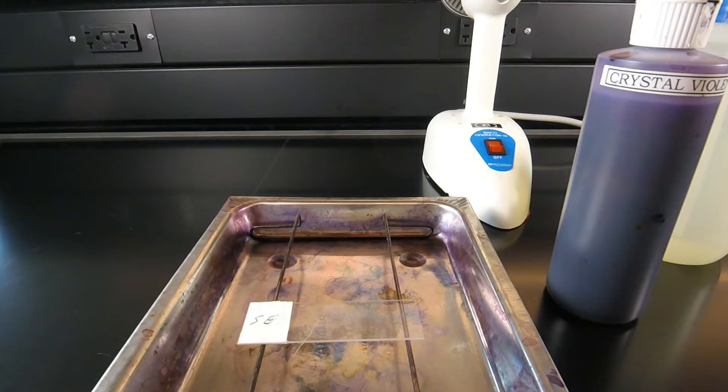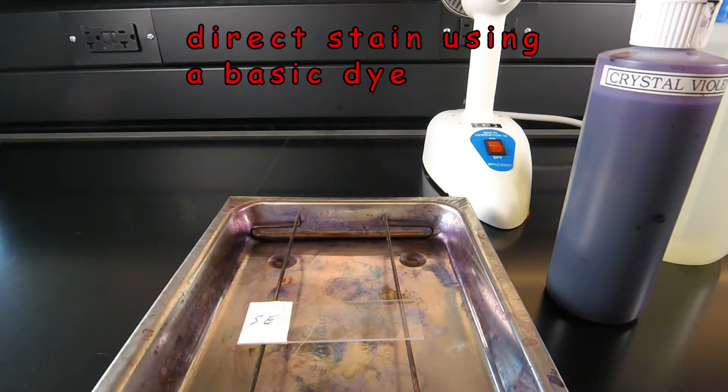In this video lesson, we're going to learn how to do a direct stain using a basic dye, in this case crystal violet.